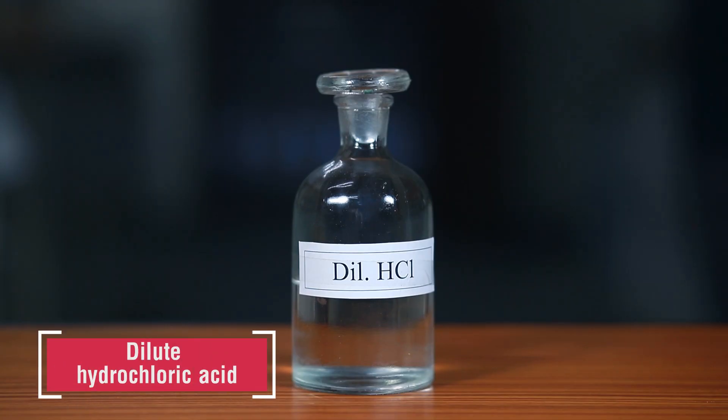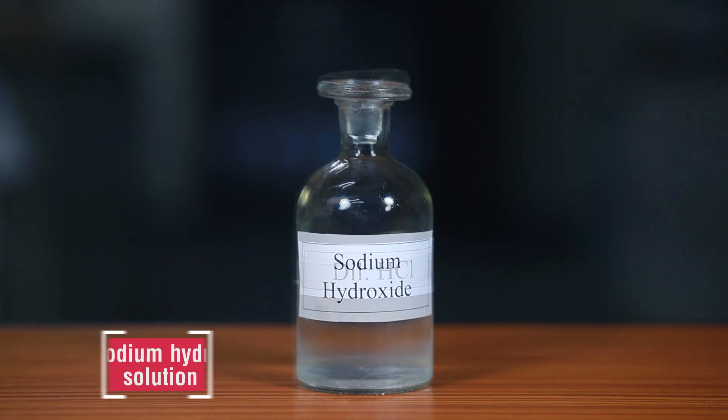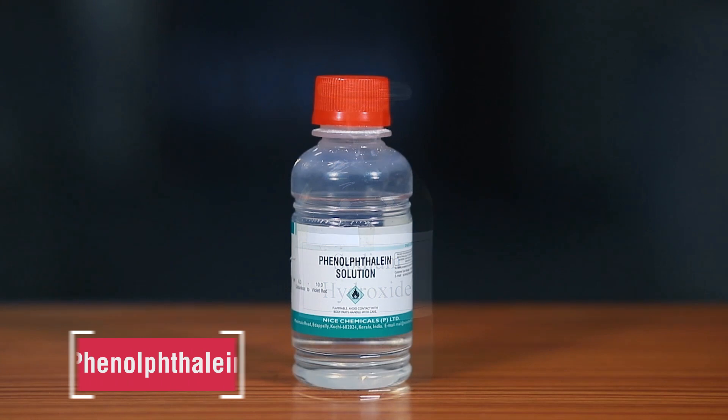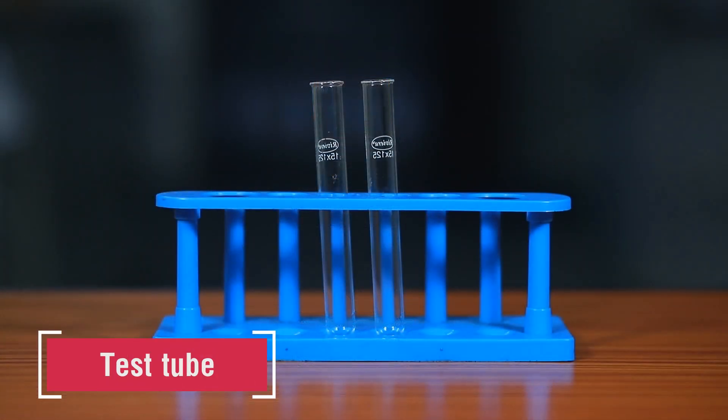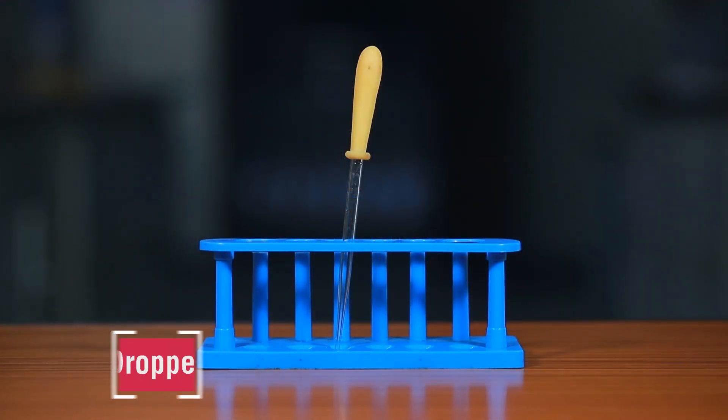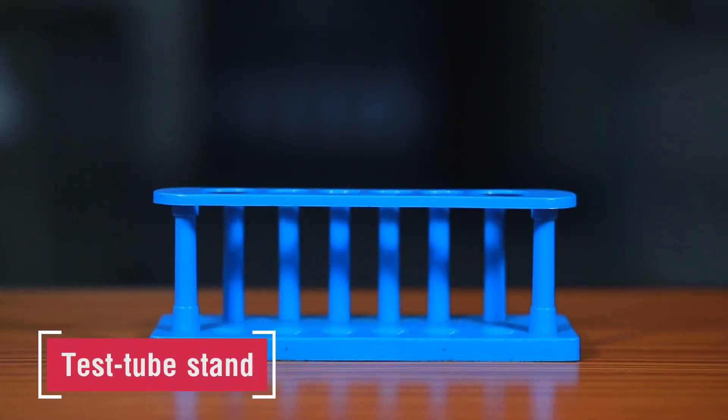Dilute hydrochloric acid, dilute sodium hydroxide solution, phenolphthalein, test tubes, dropper, test tube stand.